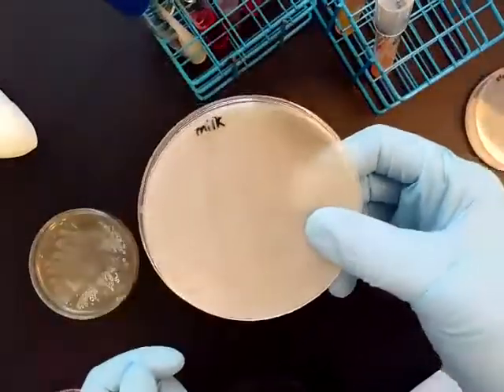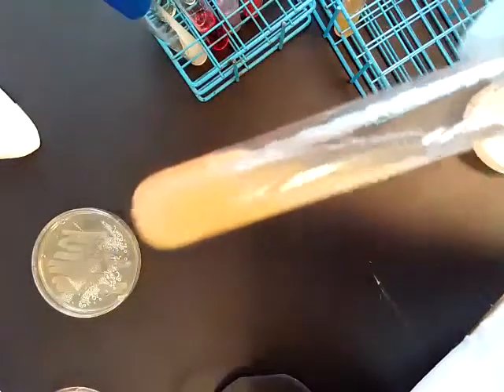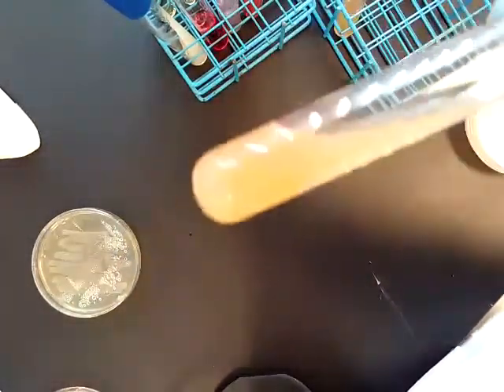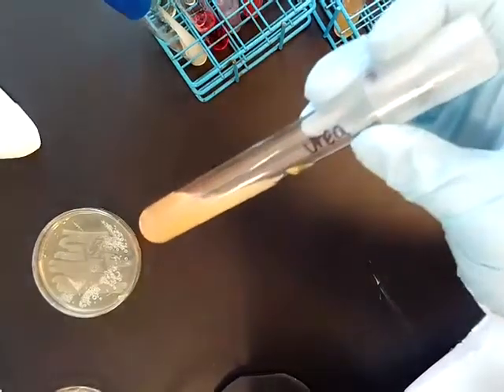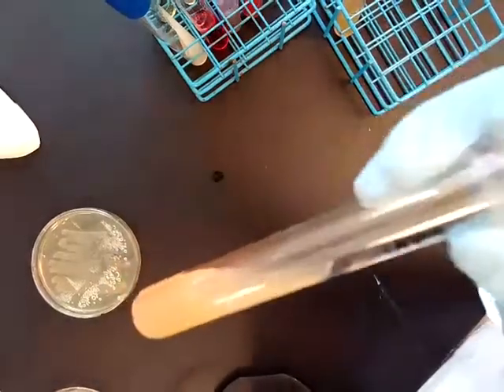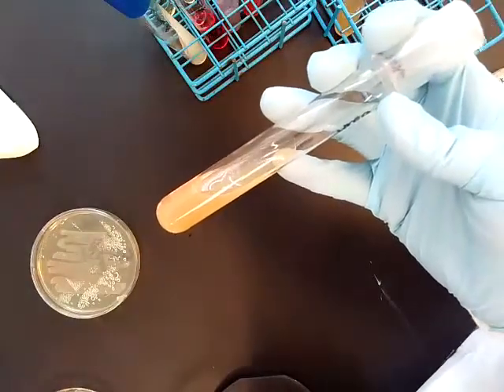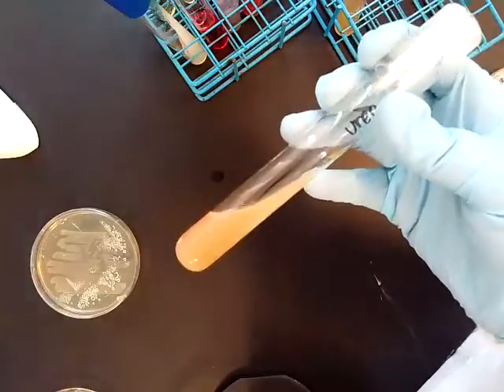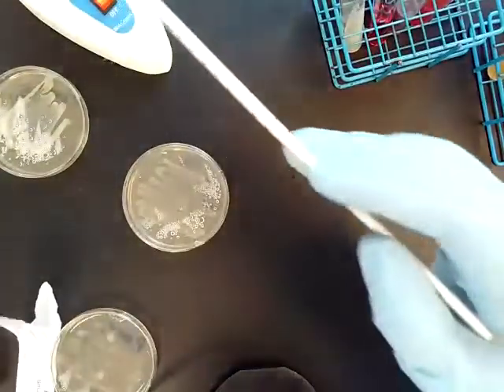You don't have to add anything to the milk agar to see the result — you'll just be able to see clearing around the area of growth. The last test is urea. Urea is found in the urine of mammals, and this test evaluates the microorganism's ability to produce the enzyme urease. Urease digests urea to produce a base, and if that base is produced it causes a bright pink color change in the media. We're going to inoculate all three of these with the same type of bacterium.